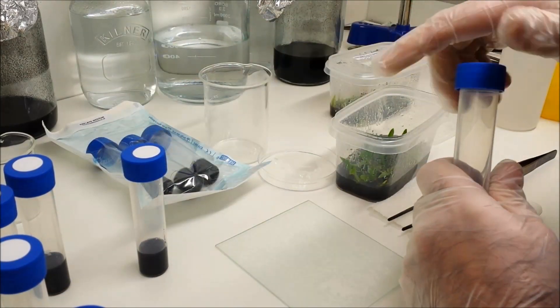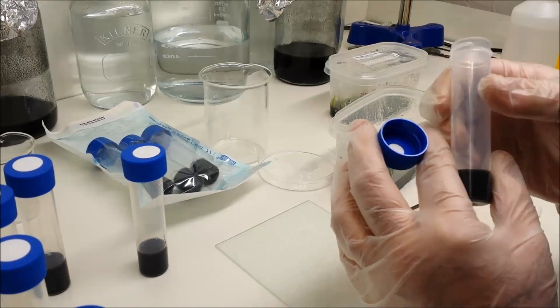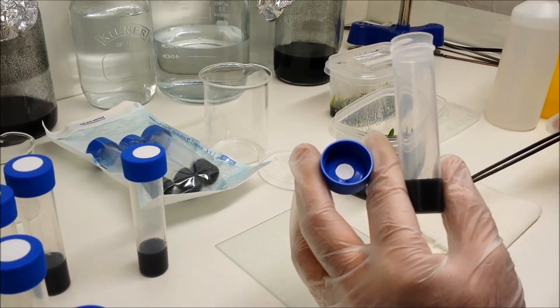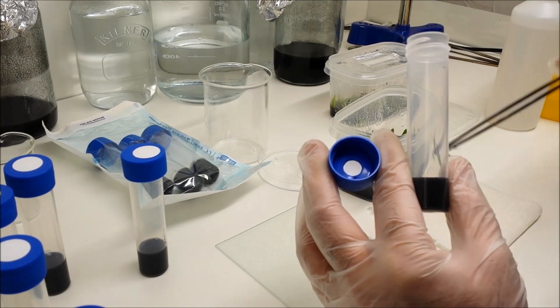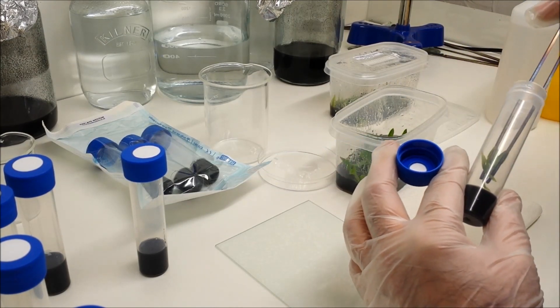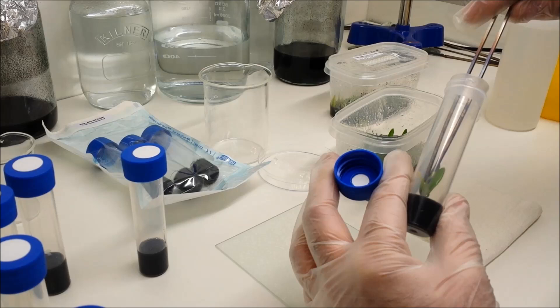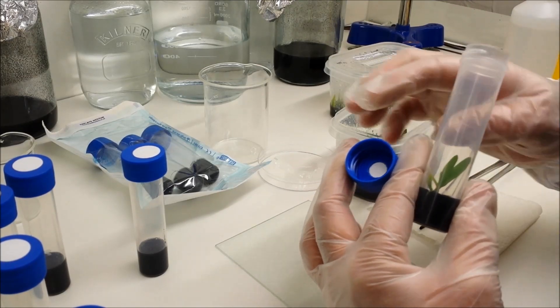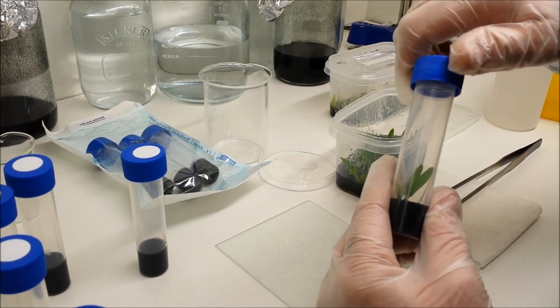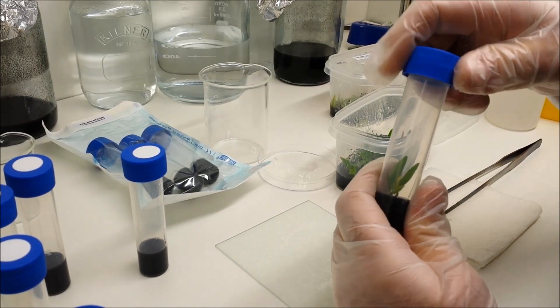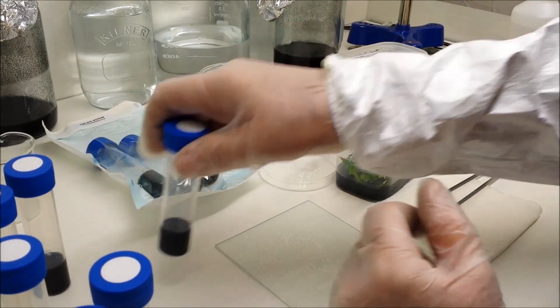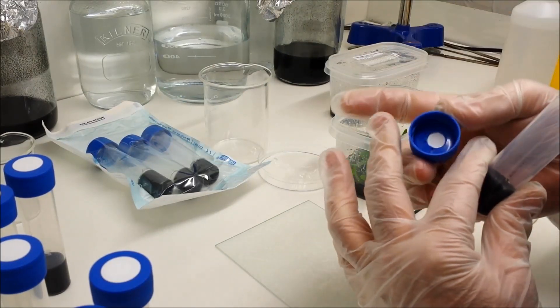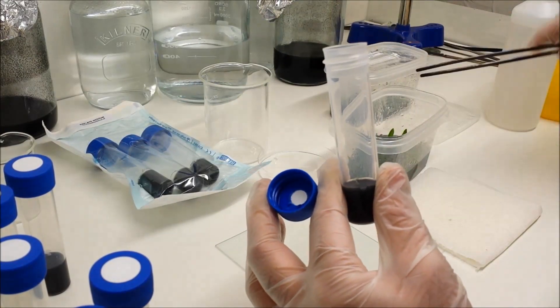I'll do a few of these just so that you get an idea of how it works. Another plant, better grasp, into the growing medium, and I'm just pushing that root in you see. On with the cap as quickly as possible. And again, cap between fingers.